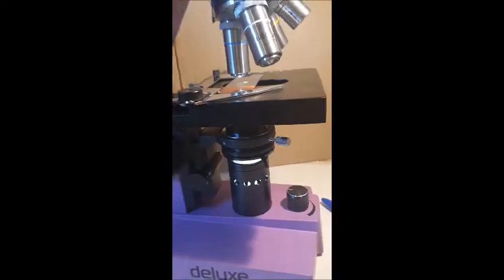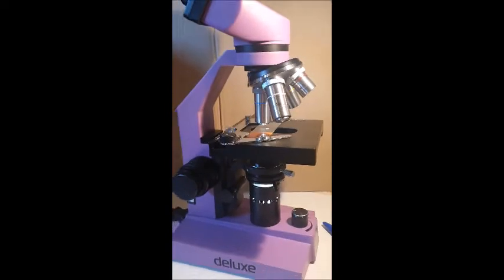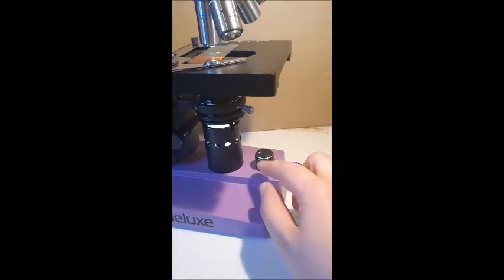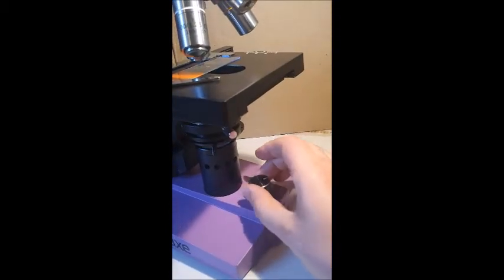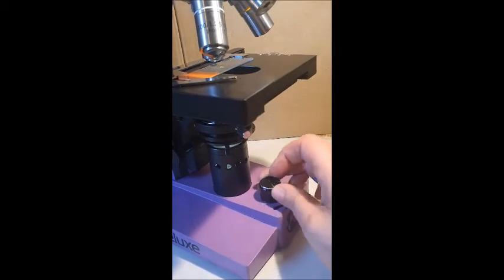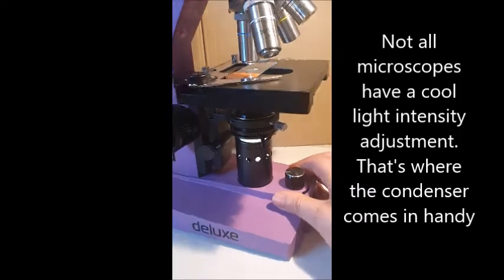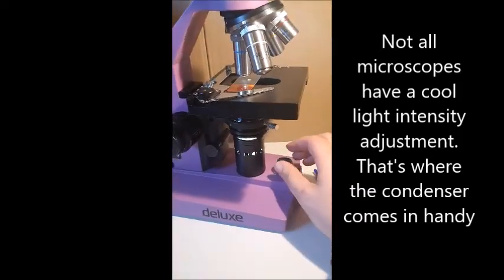But see, all microscopes are quite different, even though they all have the same basic things. So this one has this amazing light adjustment, which can actually turn your light down and up. So we don't need the condenser as much. I know it's confusing, but when you look at your orange microscopes at school, you can see the difference.